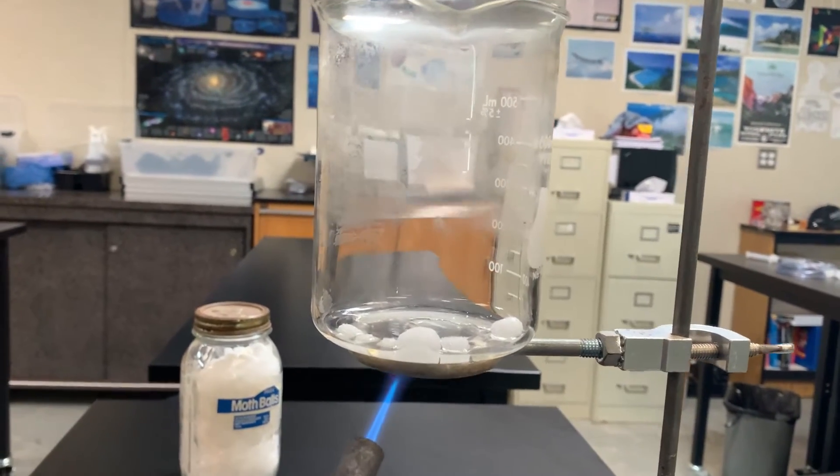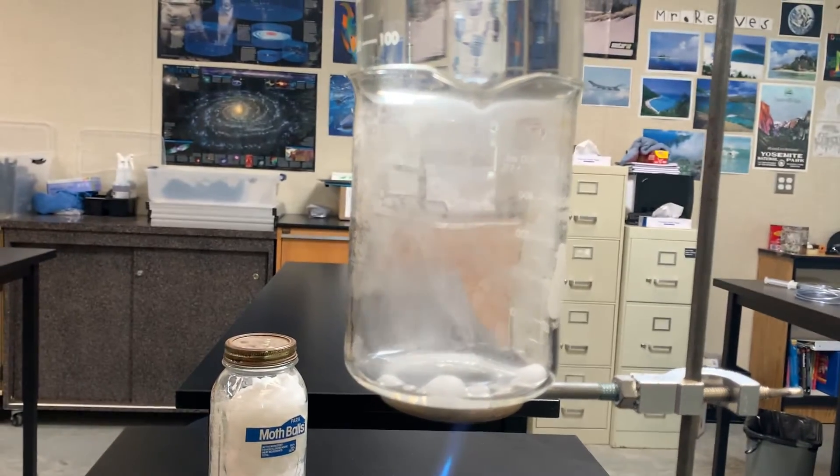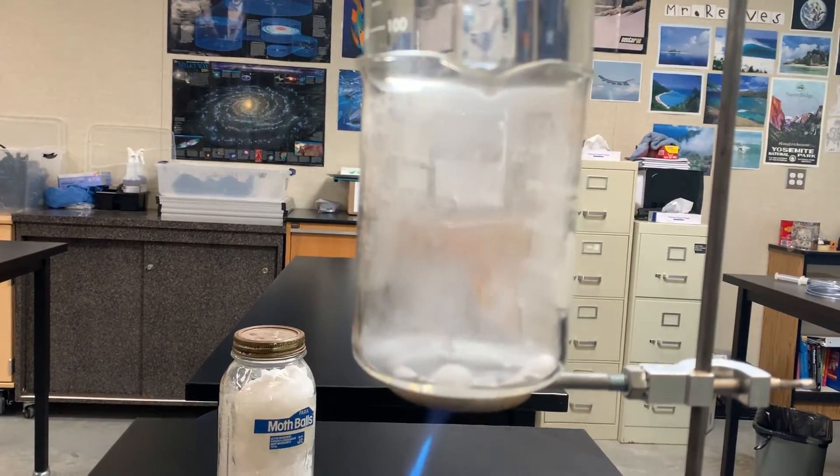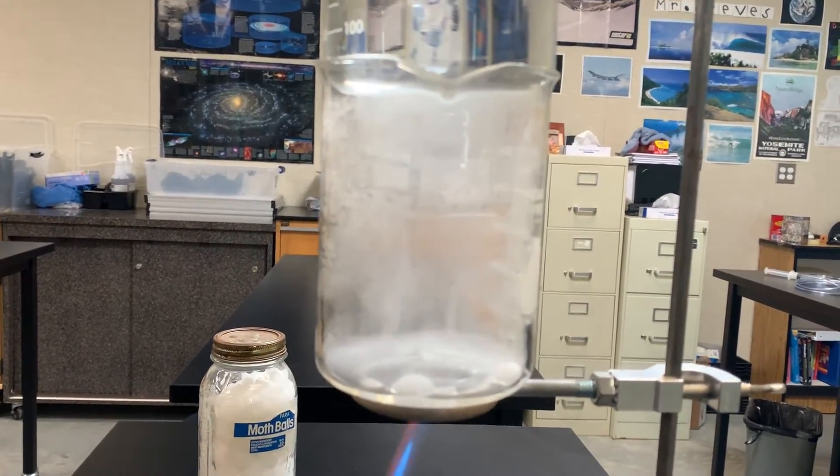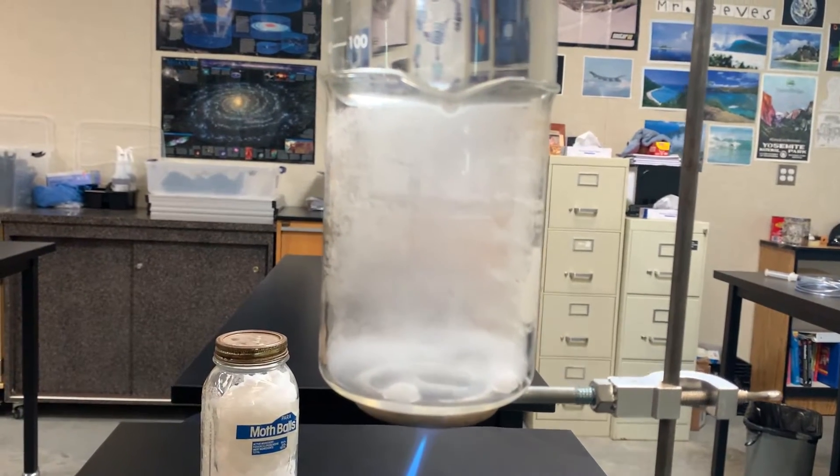And now the gas is starting to rise. You can see it's starting to fill with fumes. That's gas from the mothball, from the chemical. So it's turned to a liquid and now gas is rising up.